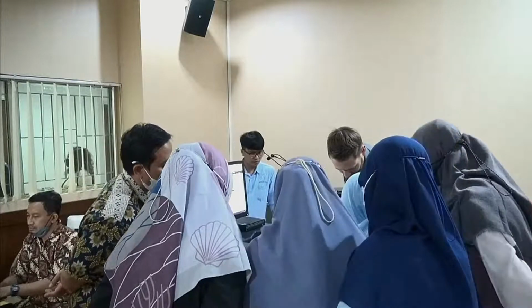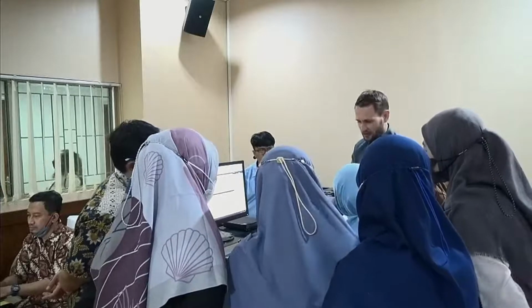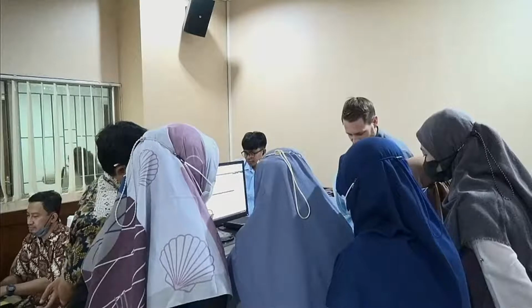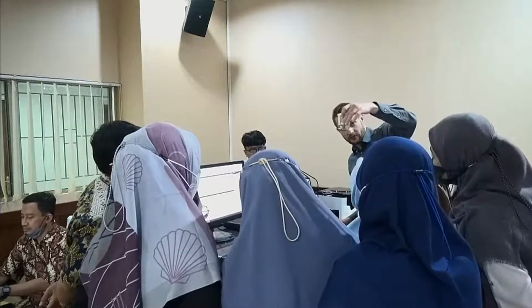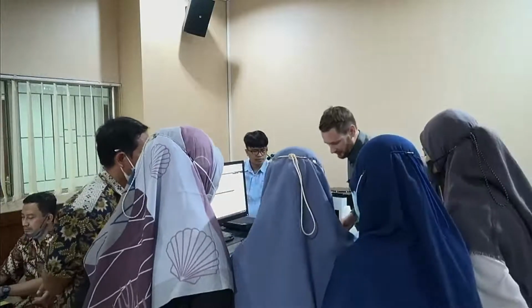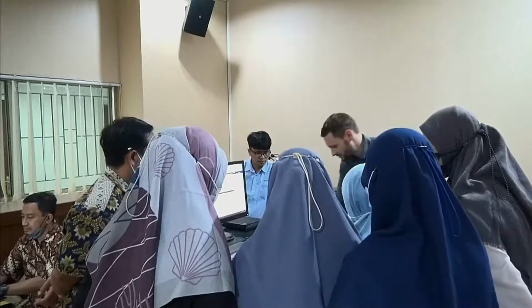It's just swimming there. If I directly add it there, I will have all the particles swimming. Maybe some are dropping down and I will measure them, but it will definitely change over time. More and more will drop, so the dispersion will be a changing dispersion during my measurement process. This is definitely something I don't want. You see down below it's still clear water with just a few particles, and those are not really nicely dispersed. So this is a good example of a sample that needs adjustment.